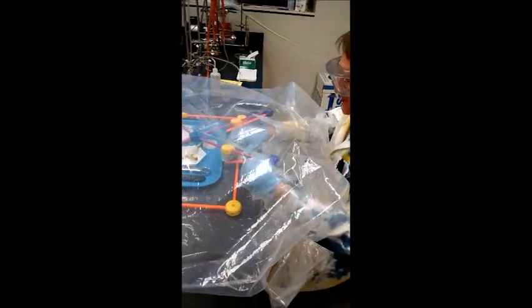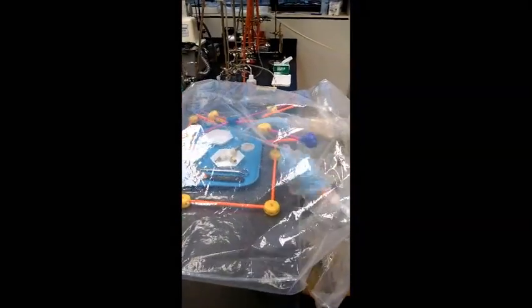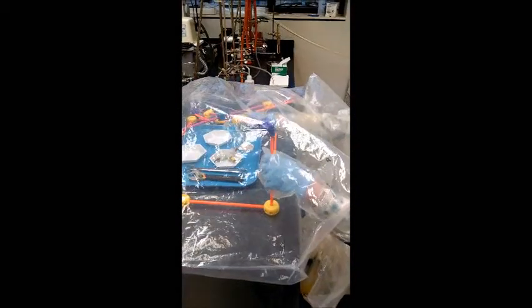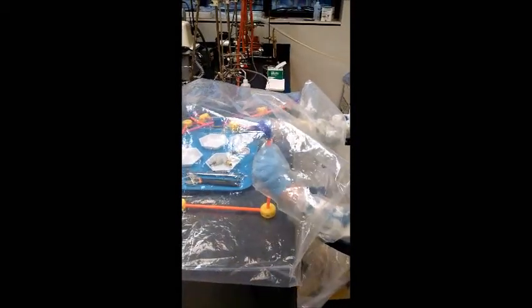Put our frame together so we have some support so we can work in the bag.